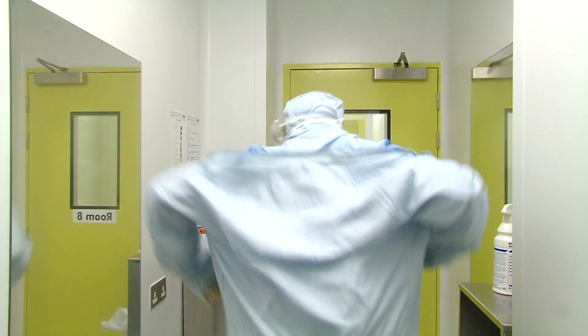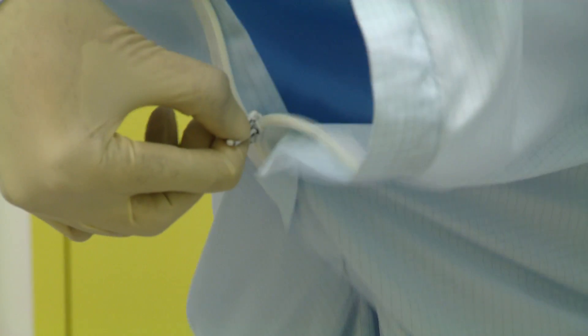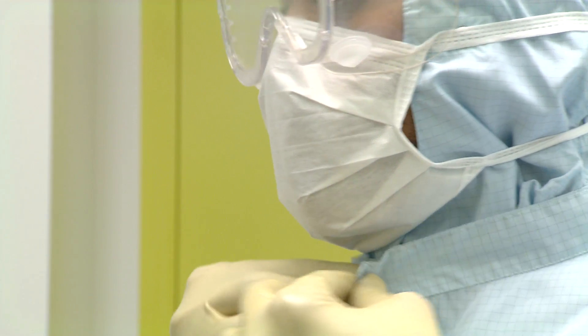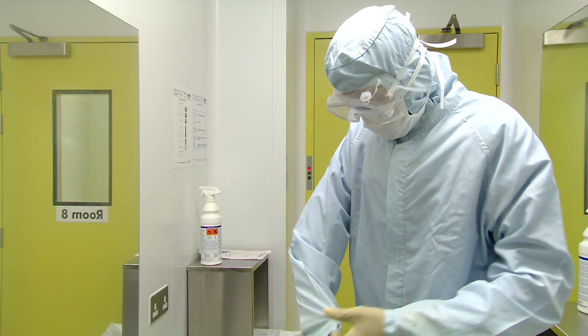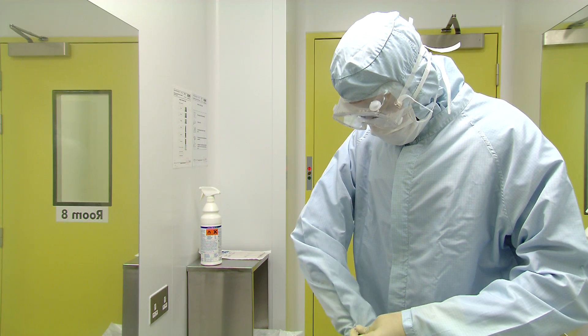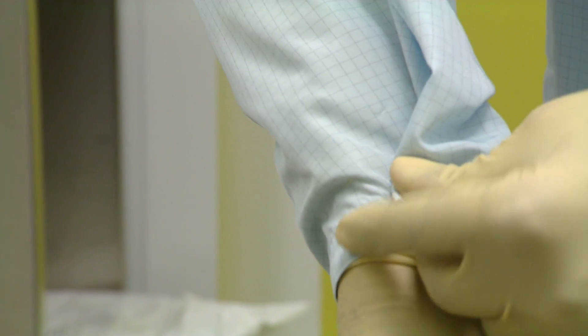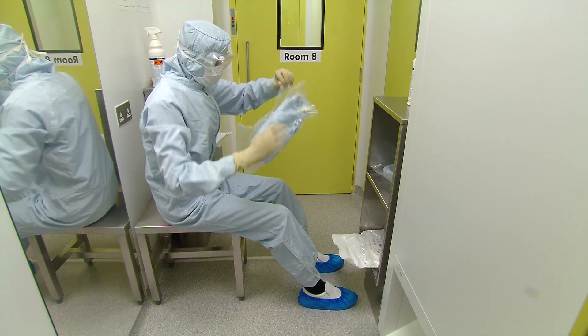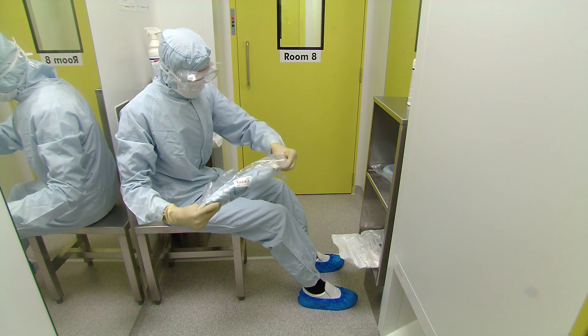The people who work in these areas are trained operators. They're trained in how to gown to enter the area and trained in all the aseptic techniques they must adhere to. Operators first take off all their outdoor clothing and put on what we call scrubs or undergarments, like you'd see in ER. Then as you work your way into the areas you wash your hands, do your hand scrubs, then put on a sterile gown, sterile mask, sterile goggles, sterile hood, and sterile booties — all put on in an aseptic manner so they don't contaminate the outside.